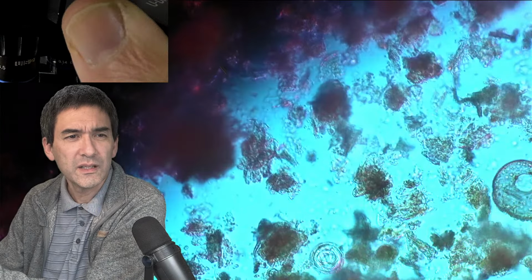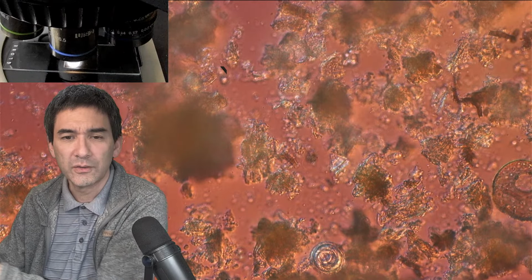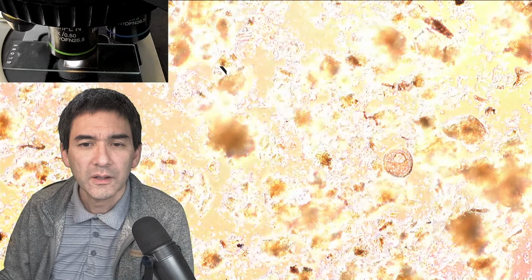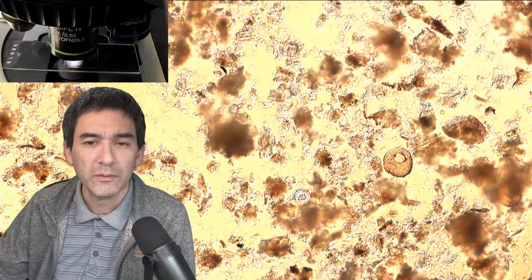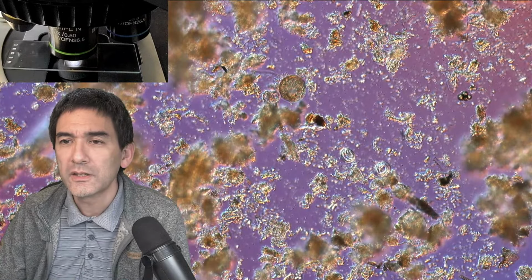Okay, so I'm putting it back in now. Look at the top again. The cable is a little bit in the way. Where is this? Here we go. See? So I can actually slide it in directly like this, and when it's in there, it locks in place. So this is how it goes. Let's go a little bit down again with the magnification. Okay, plenty of amoeba shells. So that's a little bit the thing here.